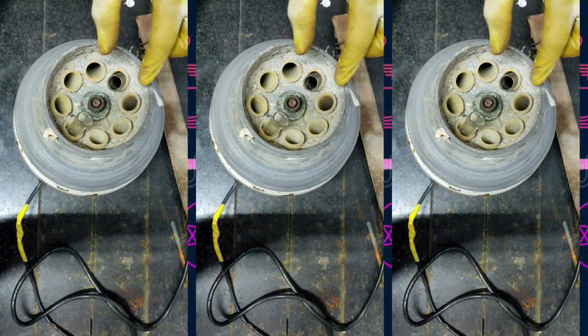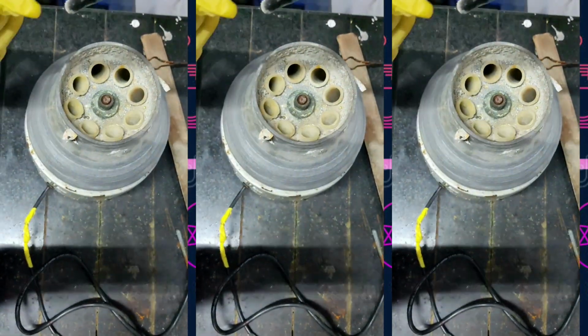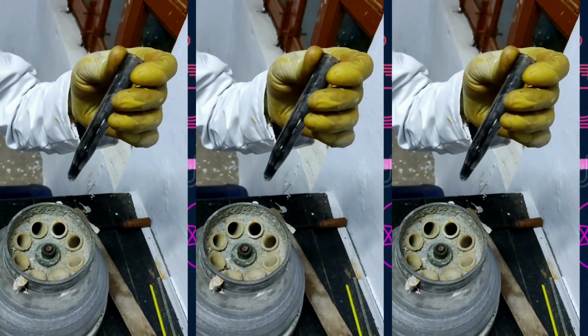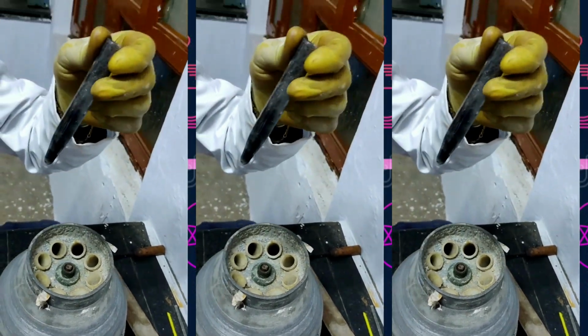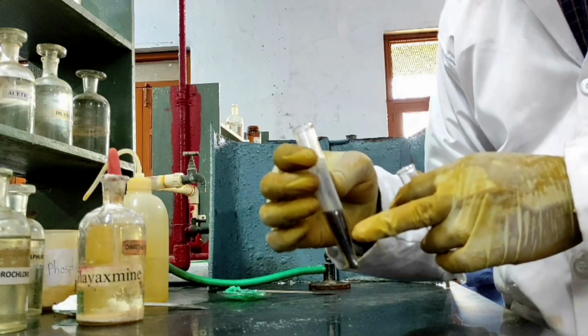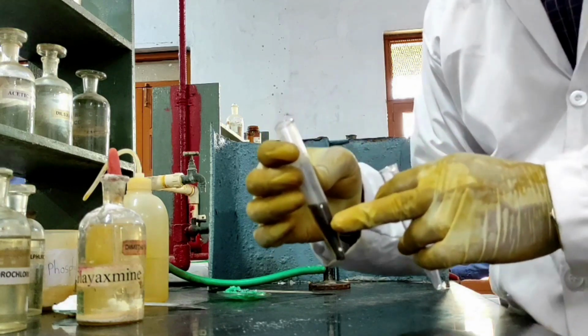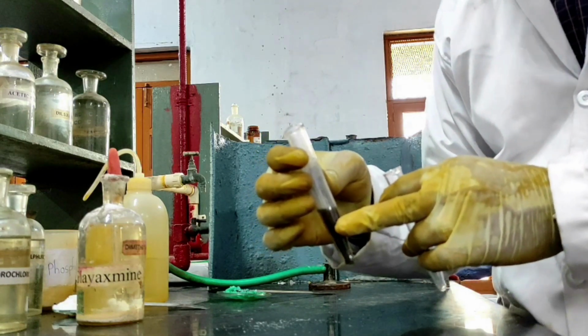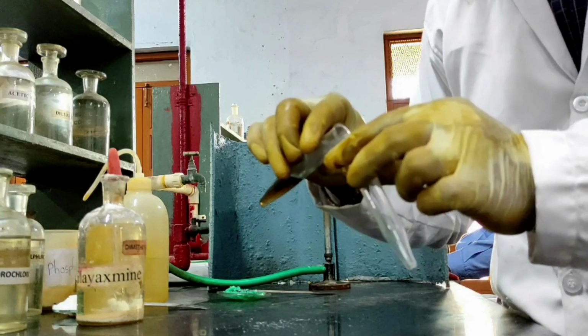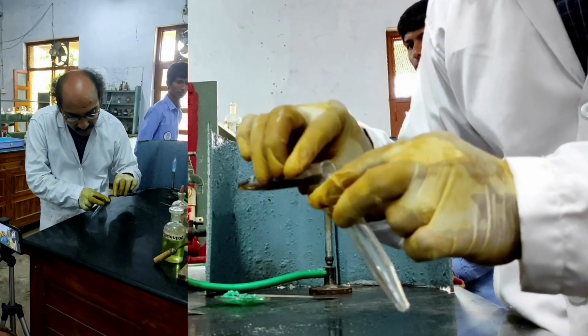Now, once the centrifugation is over, see, I got a residue, okay, and I got a centrifugate also. So now I need to separate the residue from the centrifugate. So this is the residue obtained for fourth group cations in the general group separation table. This residue must be tested for fourth group cations and the centrifugate must be tested for the presence of next group cations.